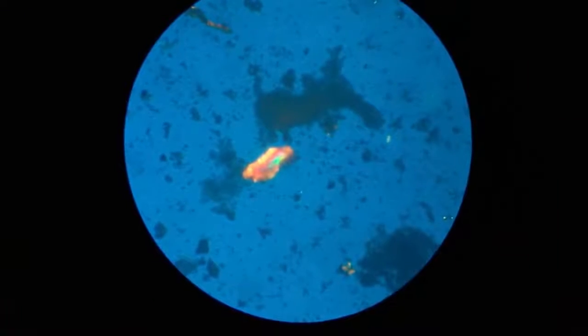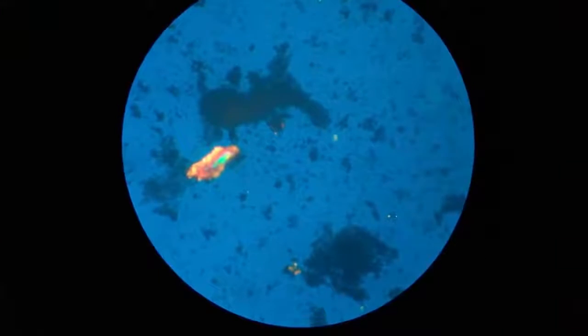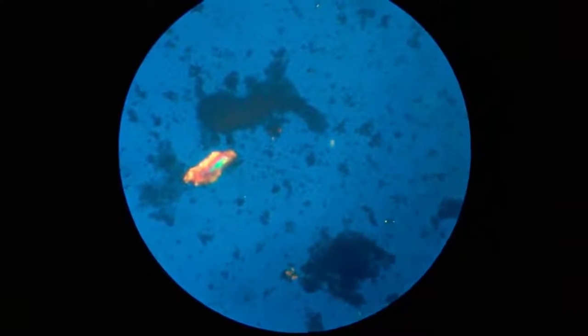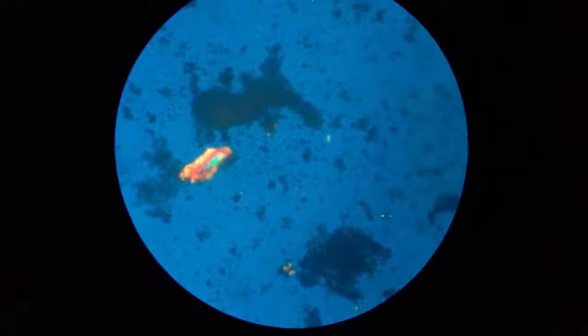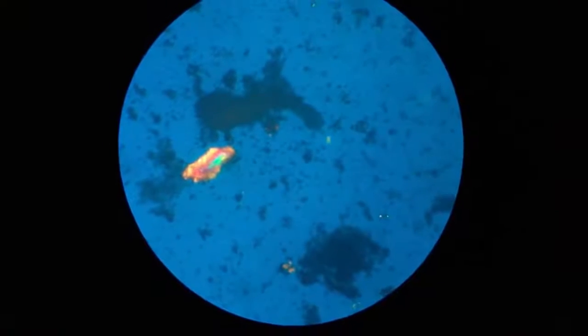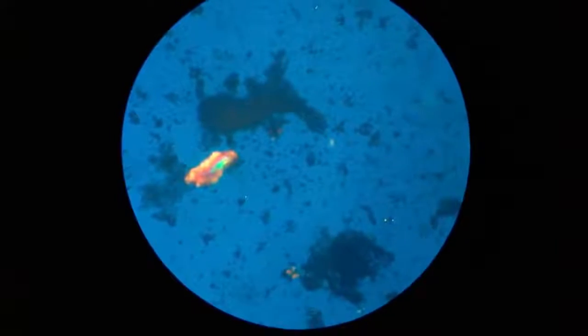So there is a crystal here, and right on top of the crystal there is a black silhouette which looks like a donkey with a very, very long proboscis. On the right hand side is the head, then there are two legs, and then there is a big stomach and a tail which is going up in the air. So now I will be removing this filter, and let us rotate the filter and see depolarized light. So this is polarized light with different wavelengths.